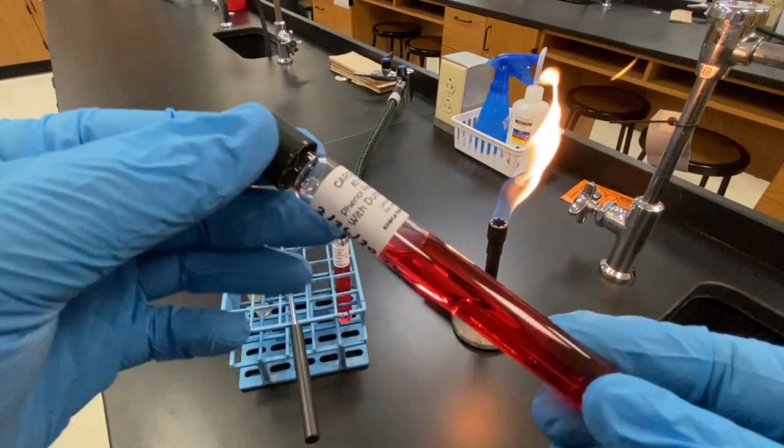This is a phenol red broth. Phenol red is the name of a pH indicator. The indicator changes color in response to the acidity or alkalinity of the media. When microbes ferment carbohydrates, acid byproducts are produced that lower the pH of the broth, which causes a color change.